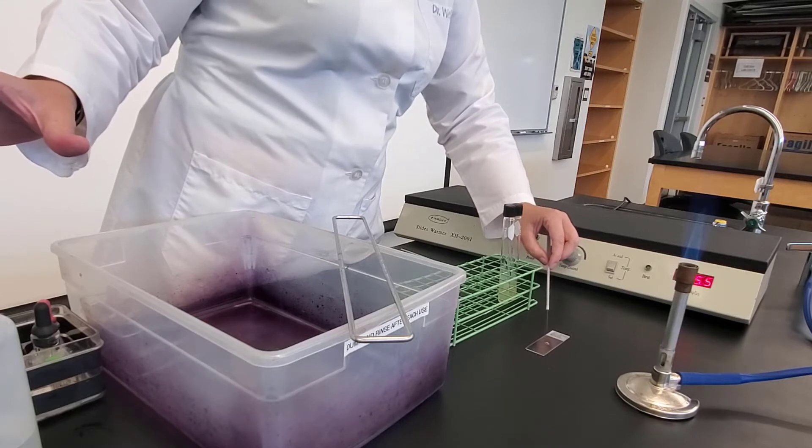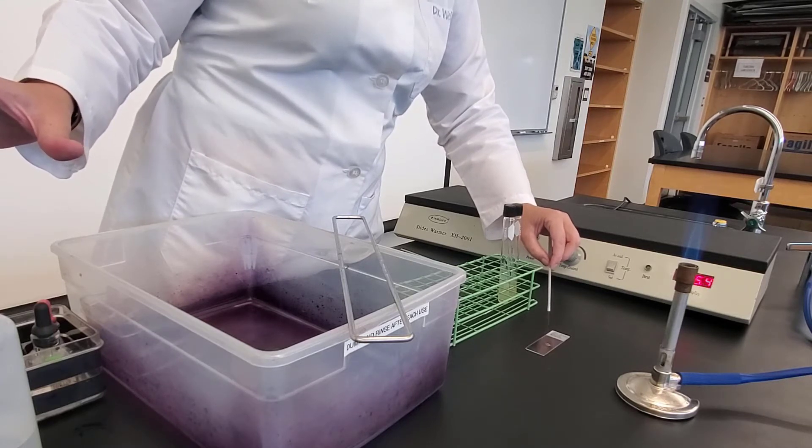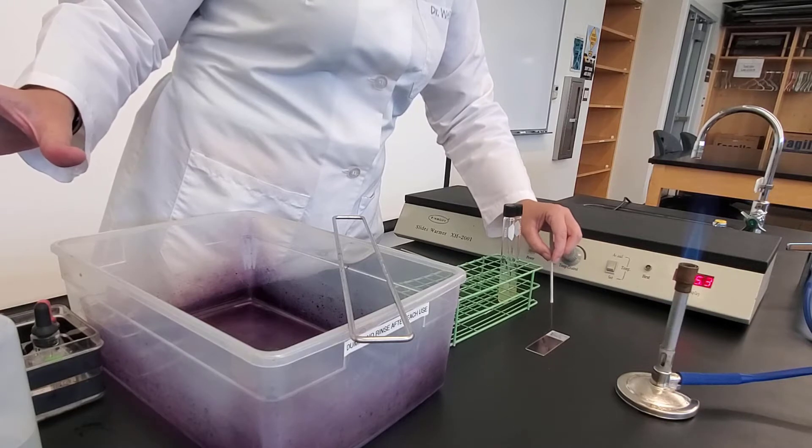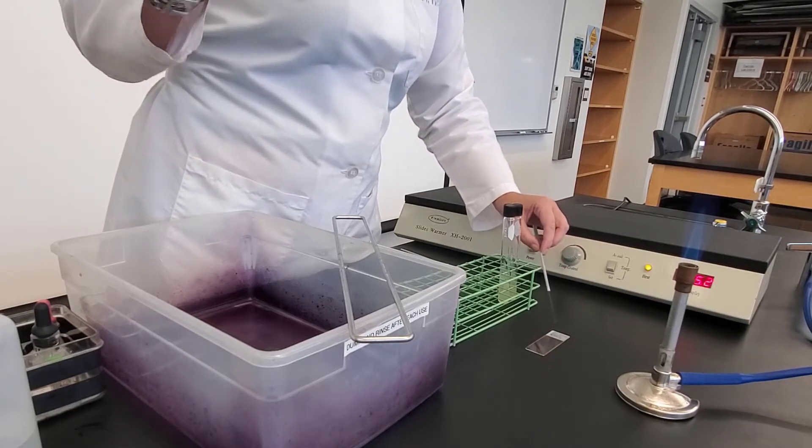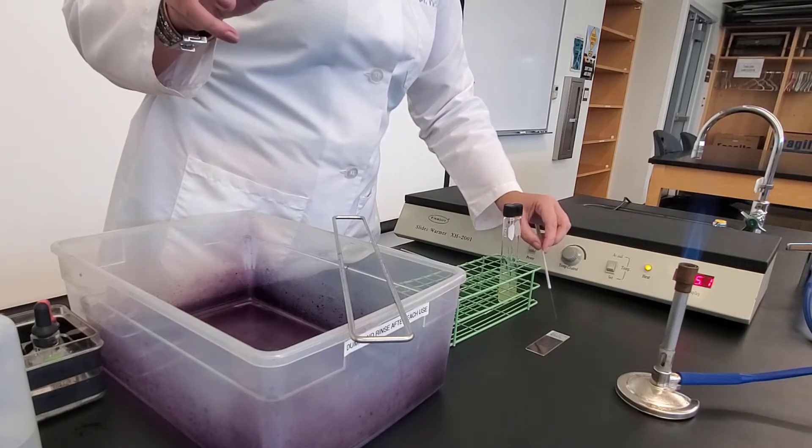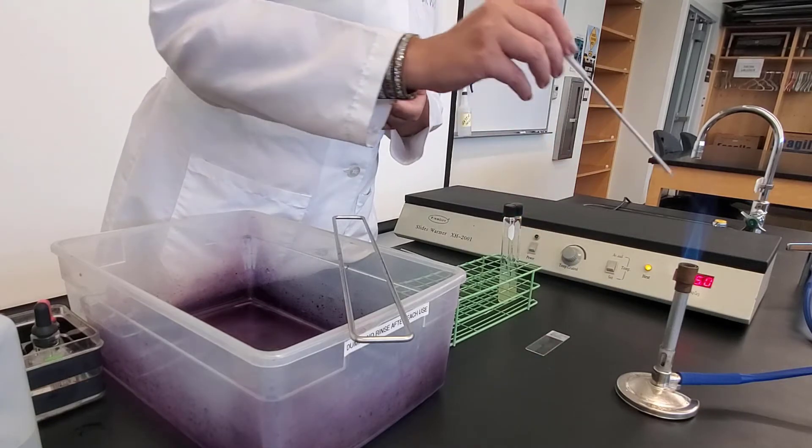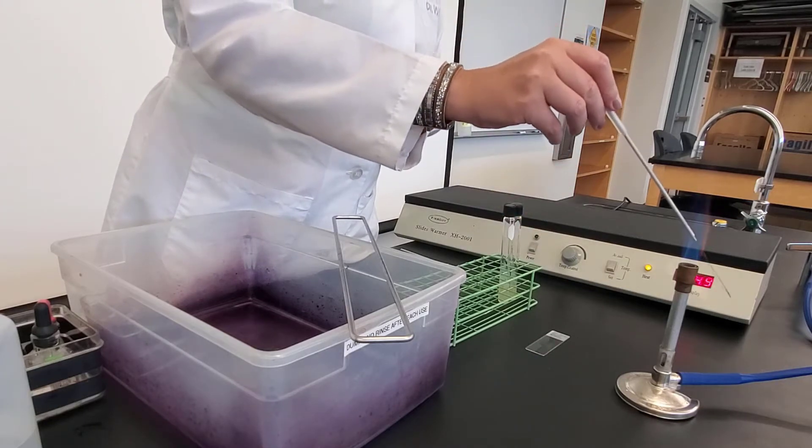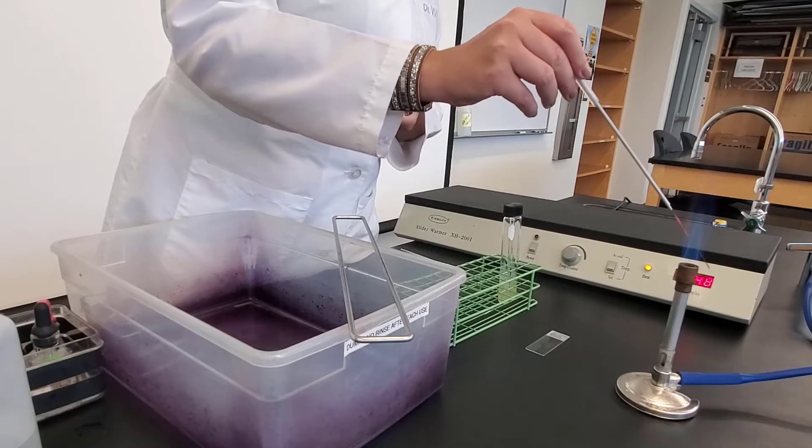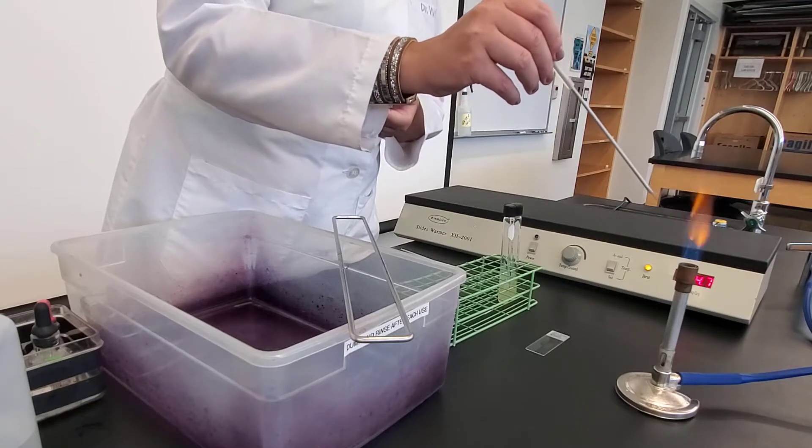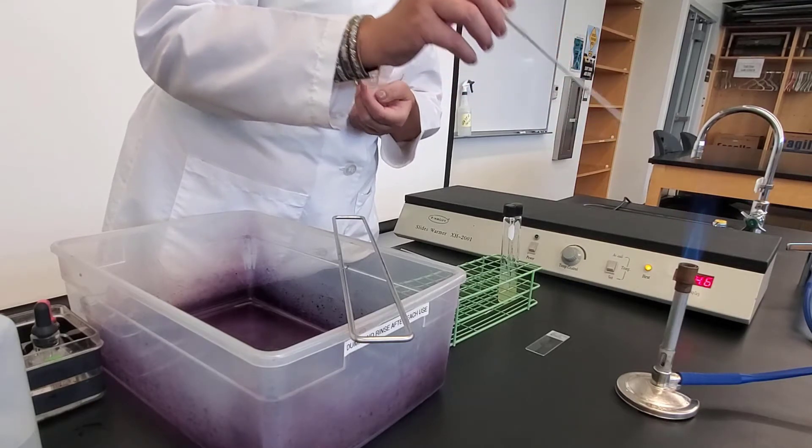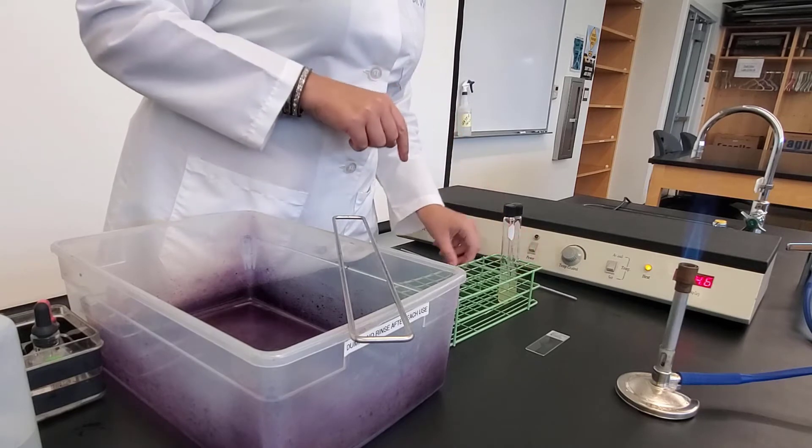Now, I didn't have to sterilize my loop because there hadn't been any bacteria. But if you wanted to be safe, you could sterilize your loop as well. So I'm just going to sterilize when I'm done just to be safe, starting from the base, working towards the tip.